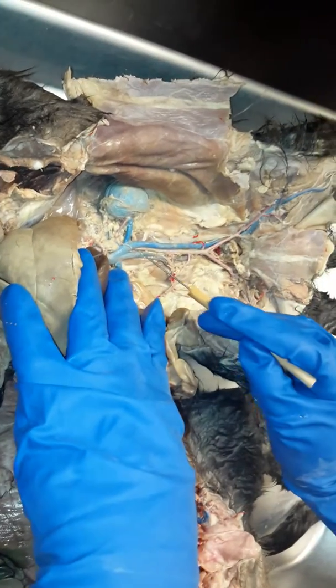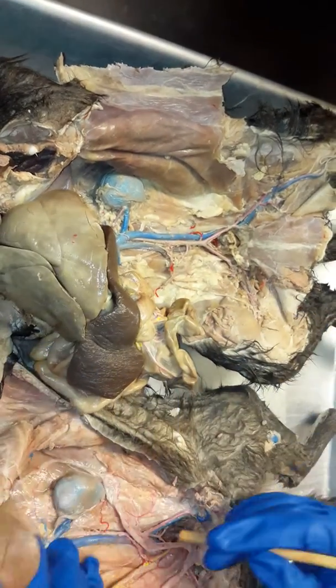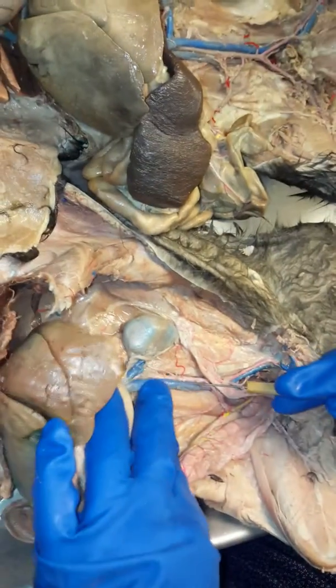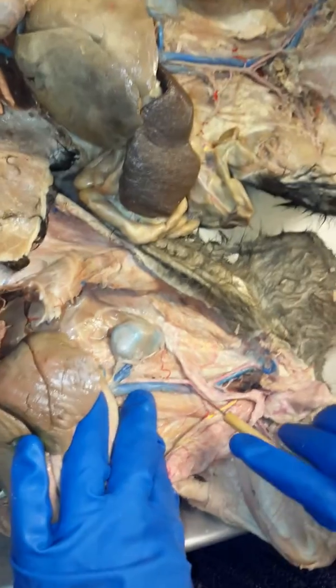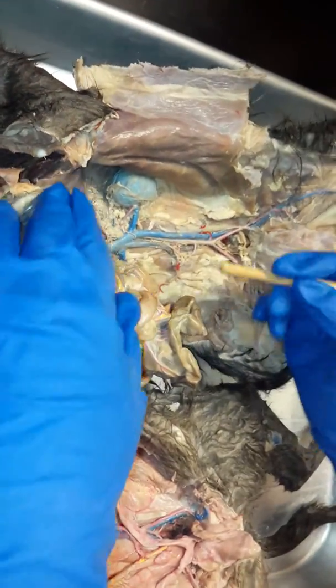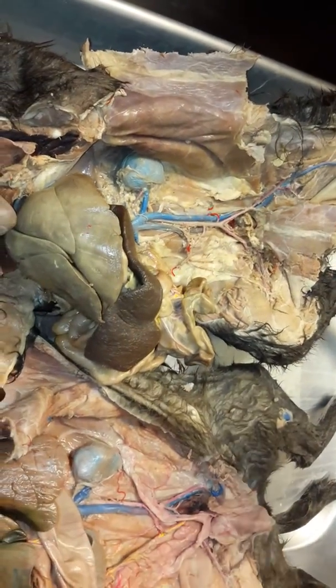Okay, so following along where the spinal cord is, that's the abdominal aorta. You can see it over here too, abdominal aorta, this main pink vessel in parallel with the inferior vena cava and the spinal cord. Okay. I like this cat because it shows the top branches a little bit better. All right, so everything's going to branch off the abdominal aorta.